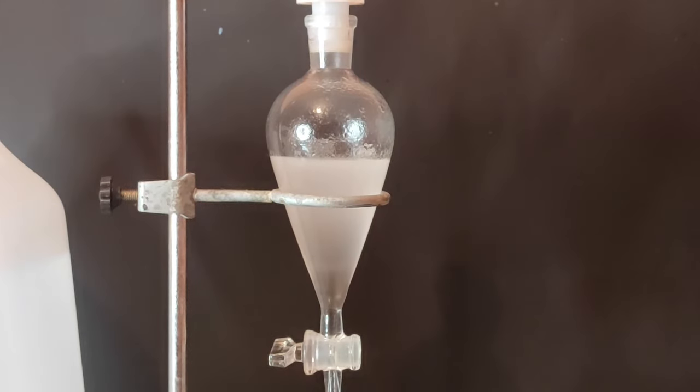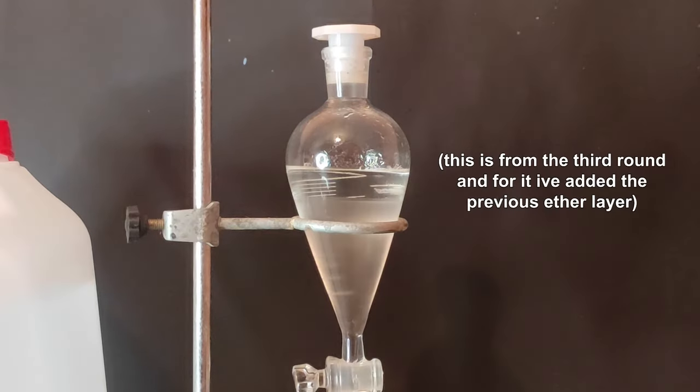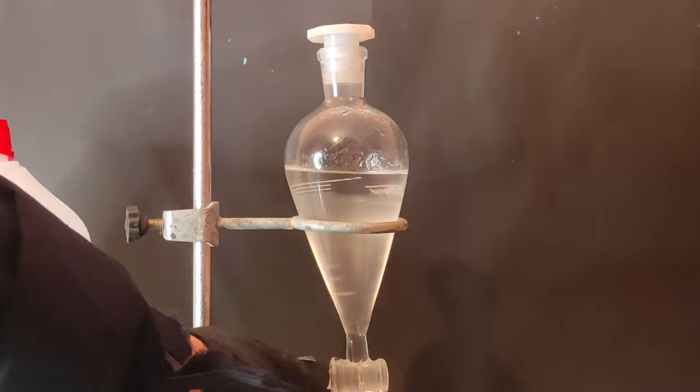Remember that when you use volatile solvents like ether, you have to sometimes vent the funnel because the pressure will build up and it can pop the cap off. After I've stopped shaking it, I've let the layer settle and I've emptied the funnel.